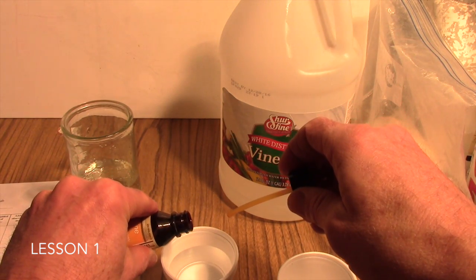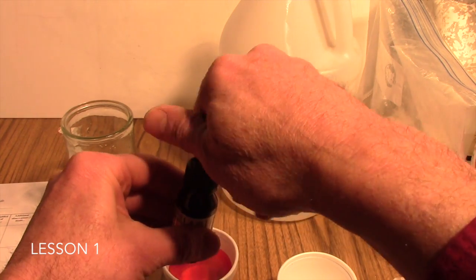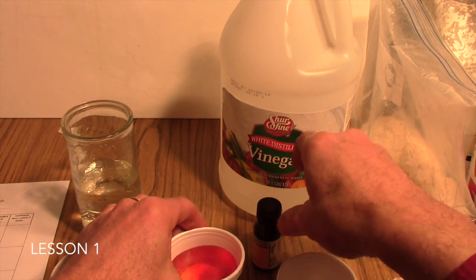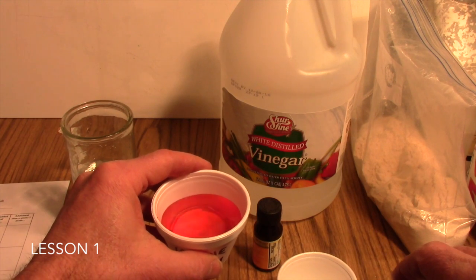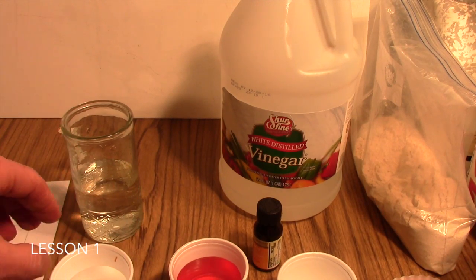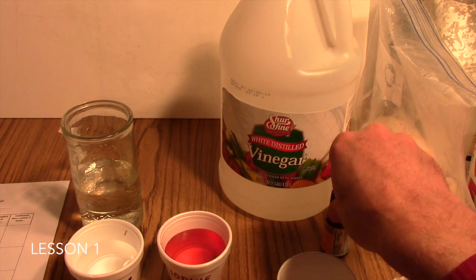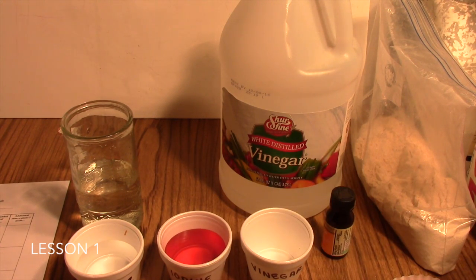And so what you'll do is just pour some into the water, and you just want a light brown color like this. This is just a light tea color of the iodine solution, which is really all you need there. Okay, so these are going to be the test solutions that your students will then draw upon when they begin getting the powders.